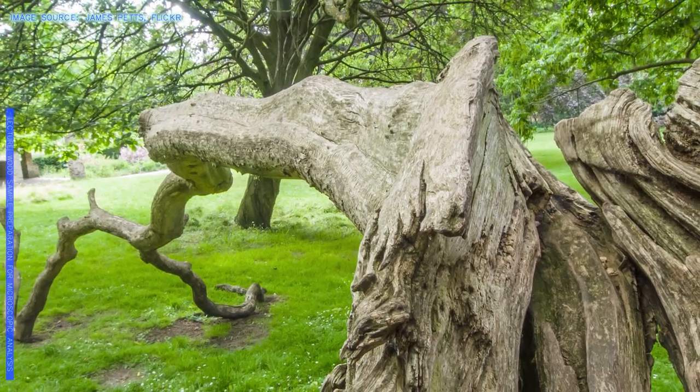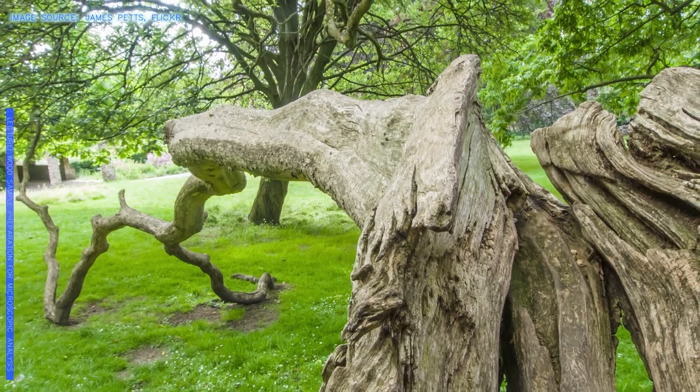What we do here is try to get really thin slices of wood samples so that we are able to see the anatomical features of it for different purposes. Some of these purposes can be the health of the tree, how old is the tree, how it is growing.